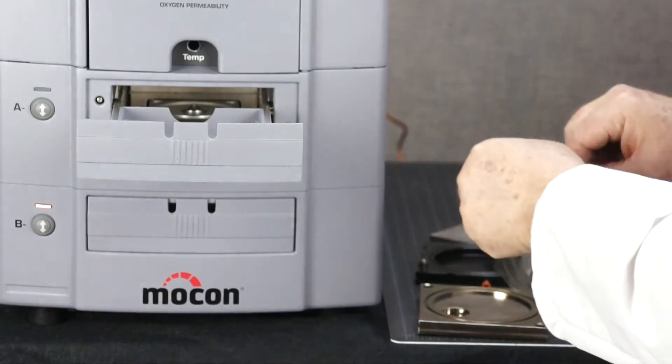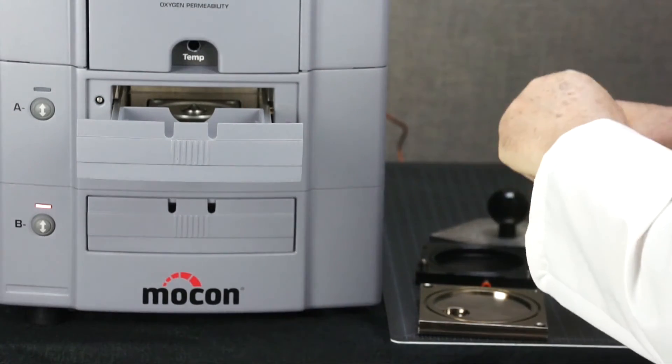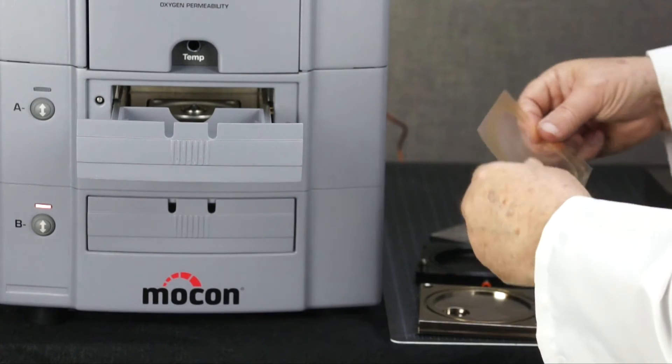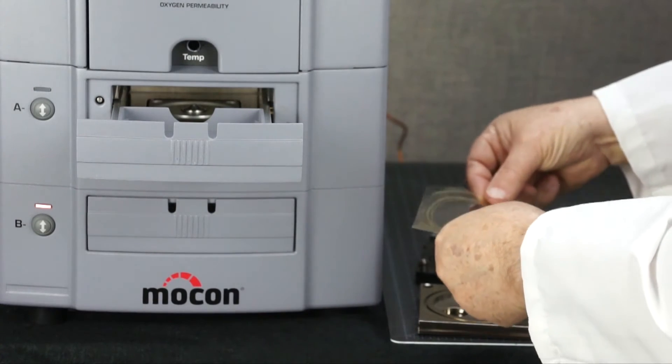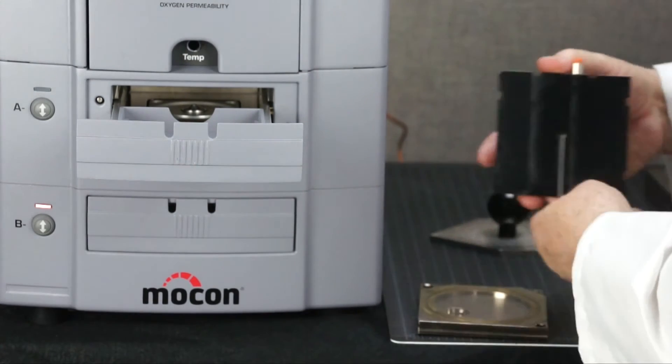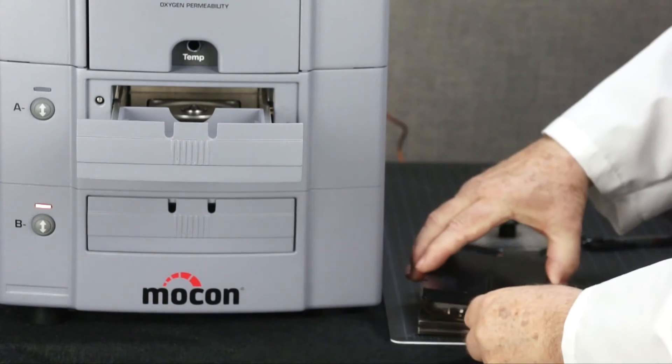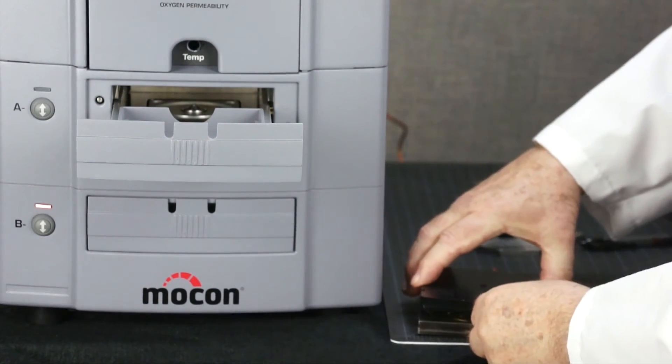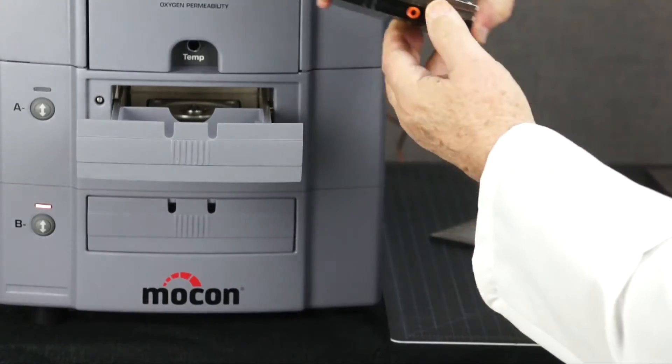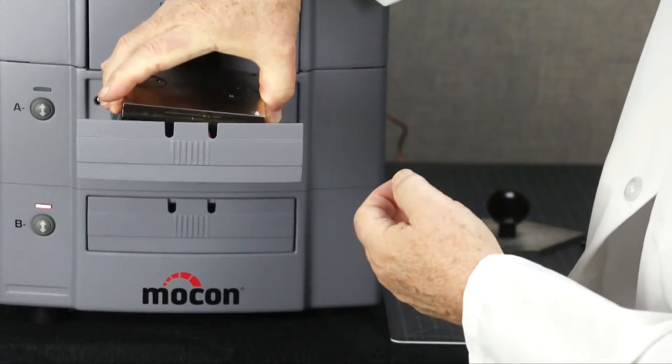Place a pre-cut film on top of the greased section. Join the two halves of the cell and place it into the instrument. Then clamp.